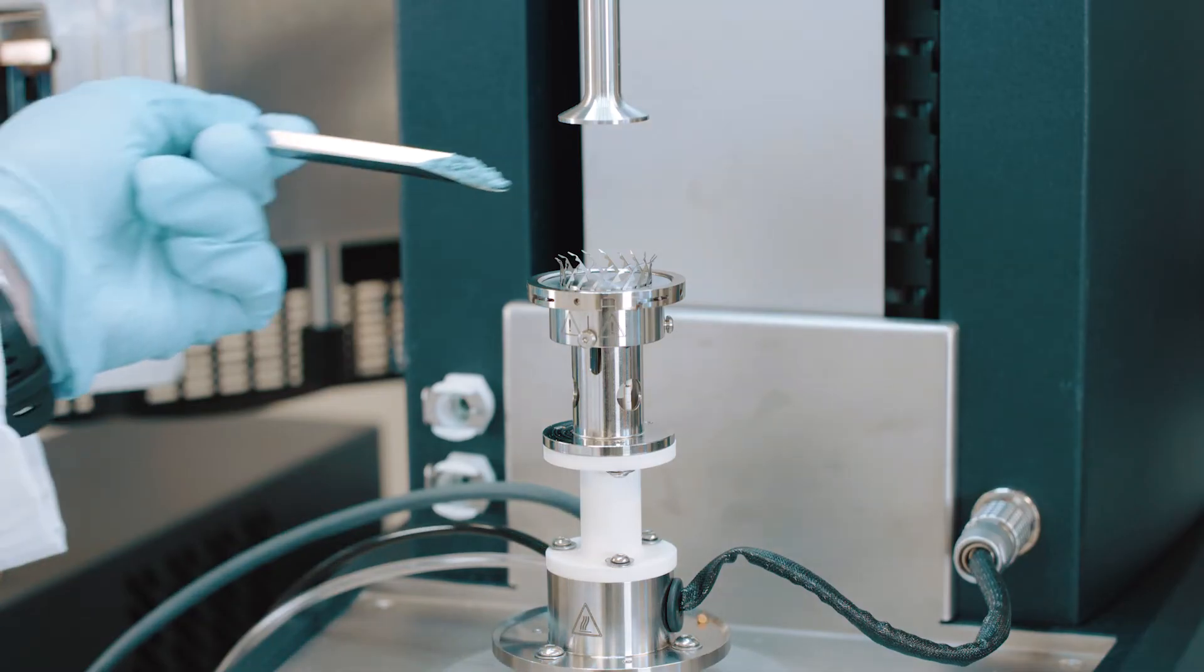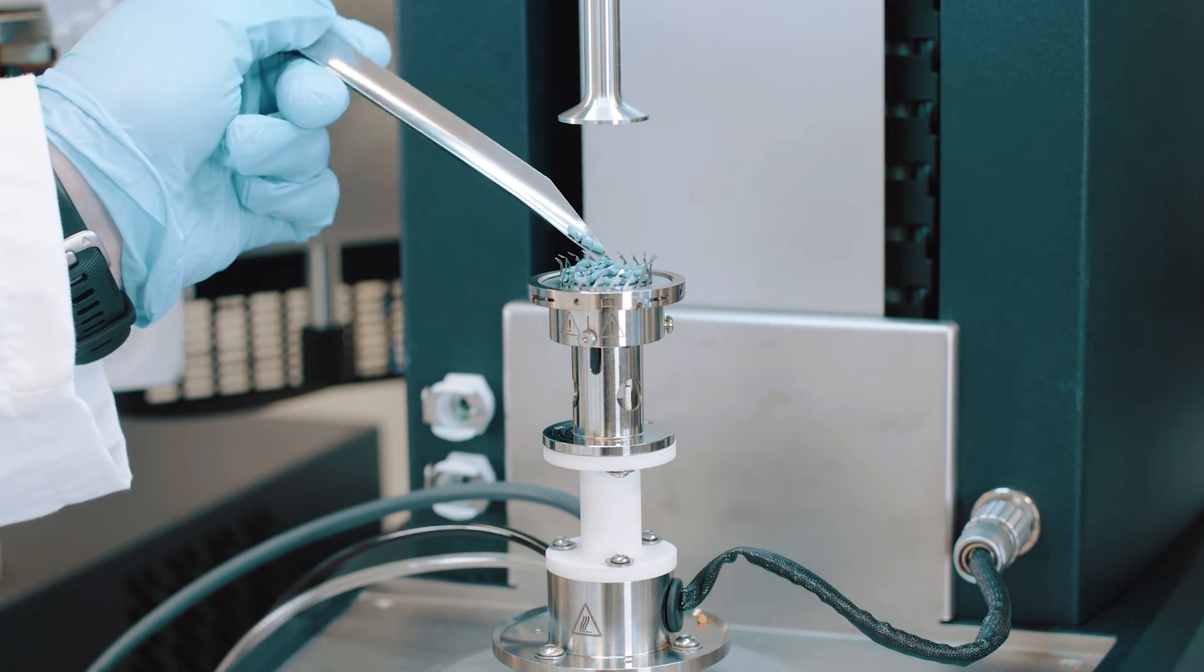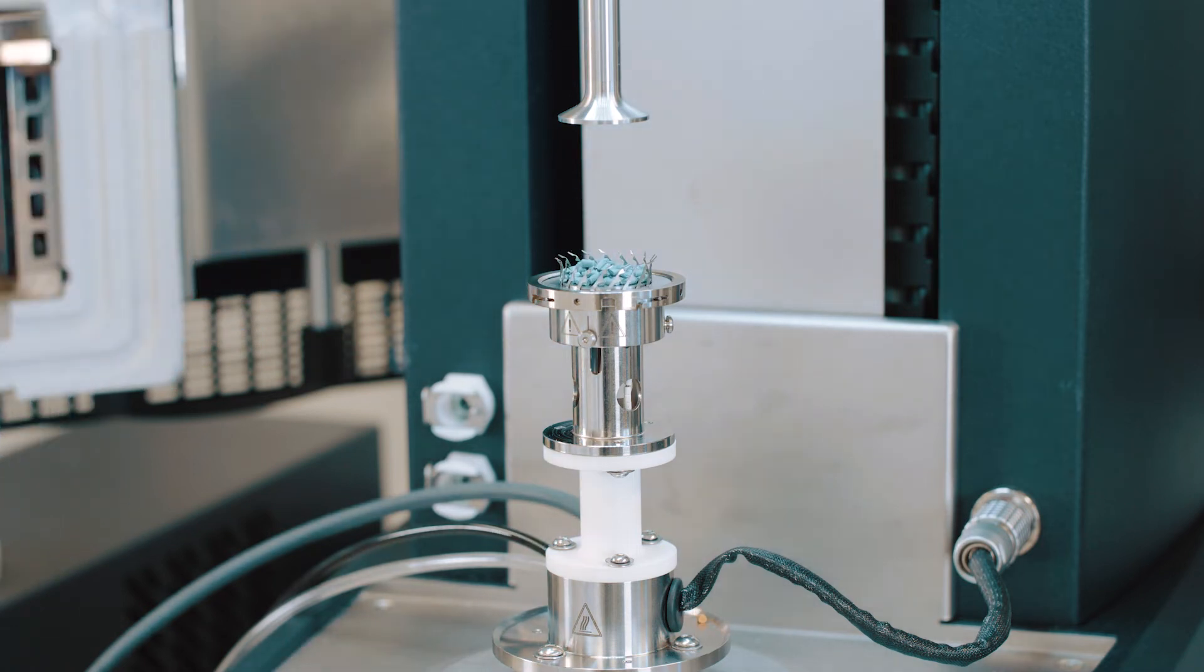Next, load sample into the disposable ring. Finally, close the oven doors.